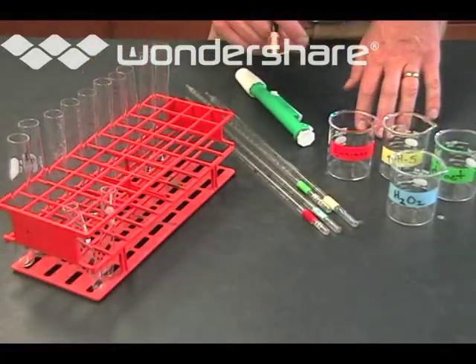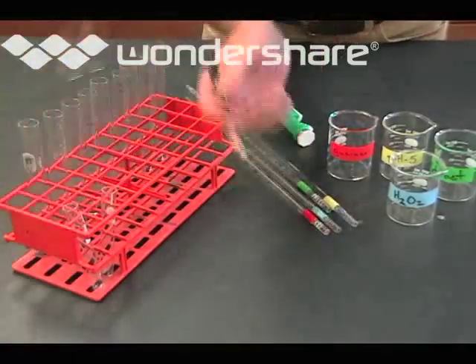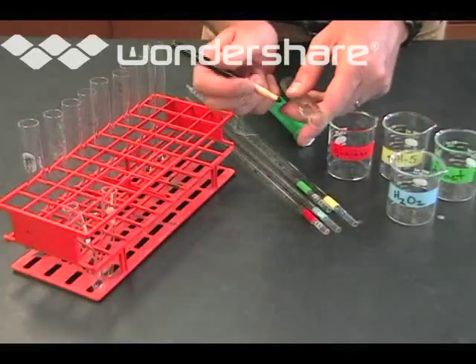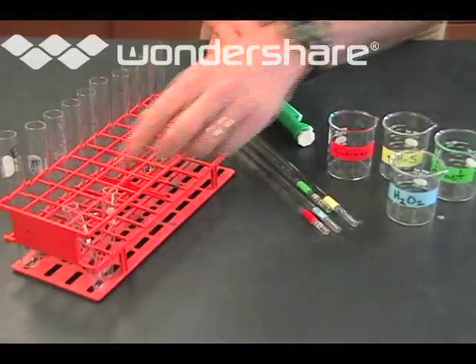This is the equipment that each group will get. First of all, you have a set of big tubes and a grease pencil, and these are the ones that you need to label either 1 through 11 for the temperature experiment or 1 through 9 for the pH experiment.